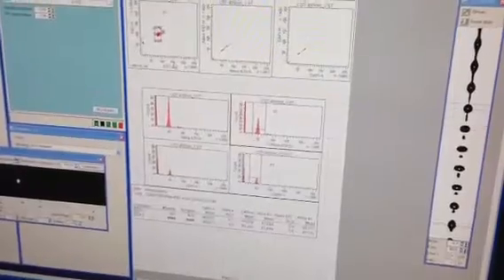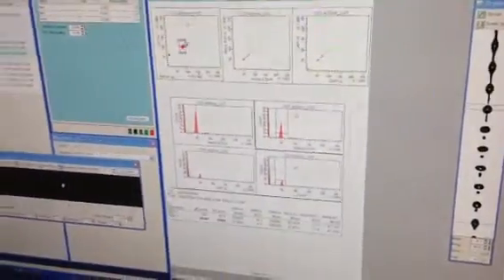But by maximized, you mean at our target we want, which is 15? Yeah. Whatever we had previously set as our standard measuring point, we want that to be maintained every time. Right. So it should not drop when you hit window extension 0. No, changing the window extension shouldn't cause that signal to drop if the particle is centered in the window. But it did change on the forward scatter, but that's just expected. Yeah.